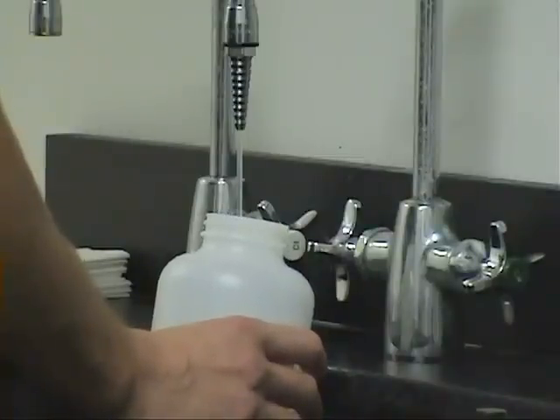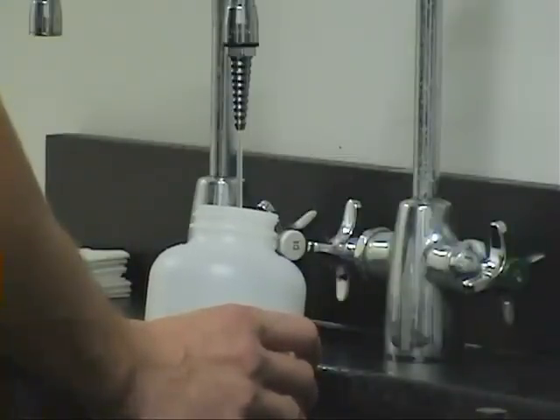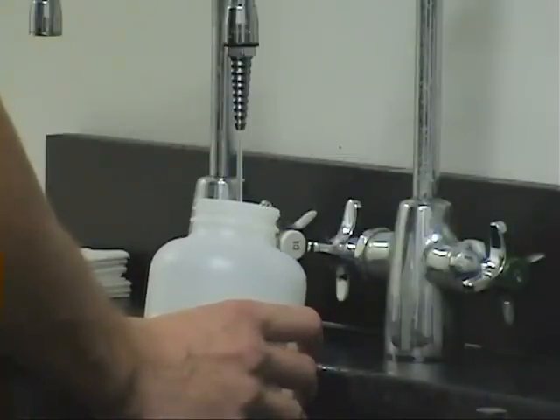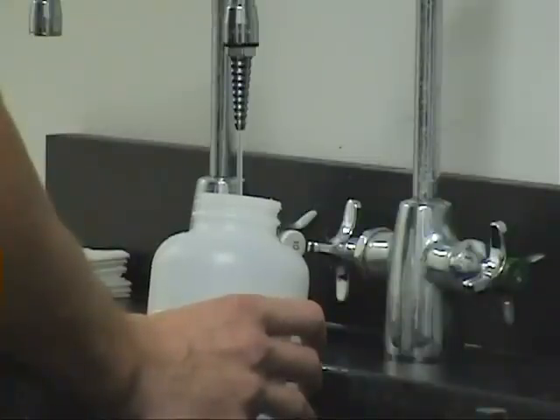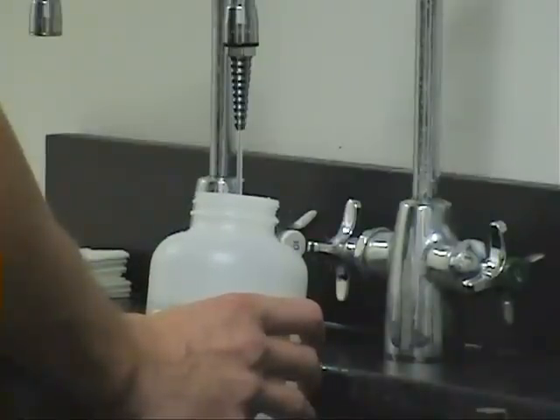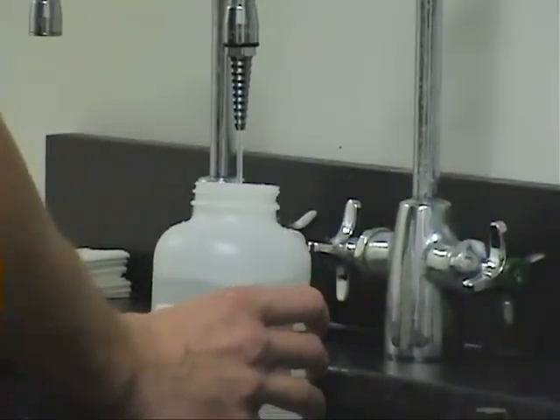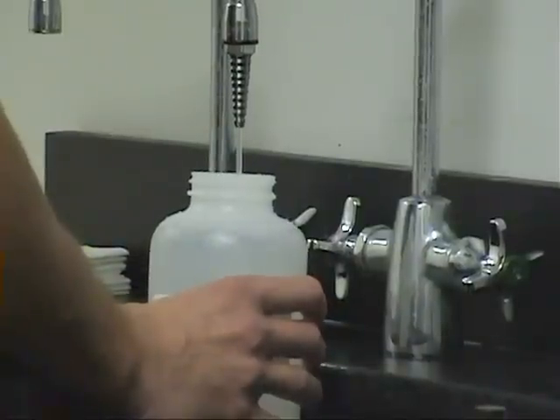Mark sample bottles appropriately. Run cold water tap for 3 to 5 minutes, then rinse sample bottle once and fill to the shoulder. Replace caps securely. The shortest hold time for the above parameters is 48 hours for nitrites. Any portion of samples used for metals analysis will be preserved at the lab with nitric acid to a pH of less than 2.0.